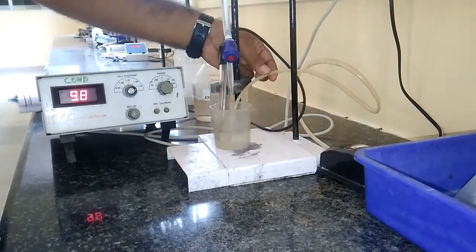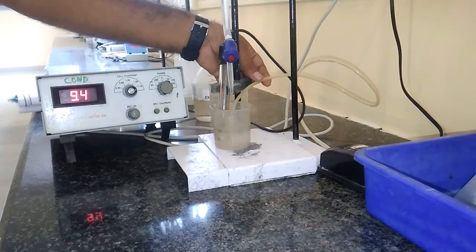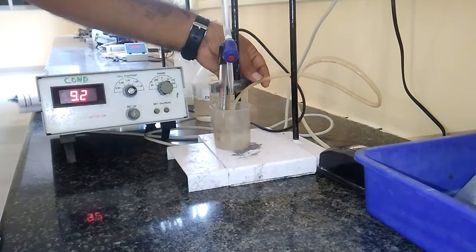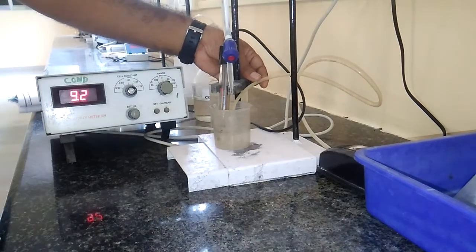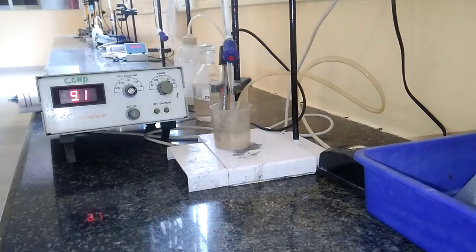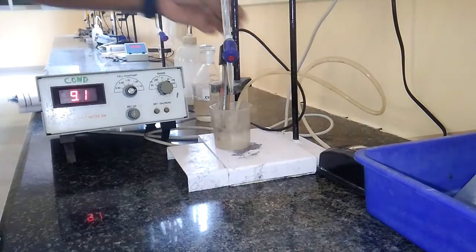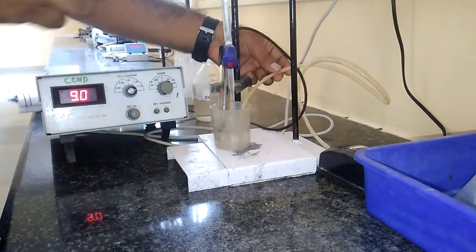At around 4 to 4.5 ml, there will be a slight increase in the conductance values. That is due to the formation of a salt between the weak acid and the strong base — that is sodium acetate. This means the second acid, the weak acid, begins to neutralize — acetic acid begins to neutralize. At the end of the conductometric titration, there will be a sudden rise in the conductance values due to the addition of excess hydroxide ions from the NaOH.